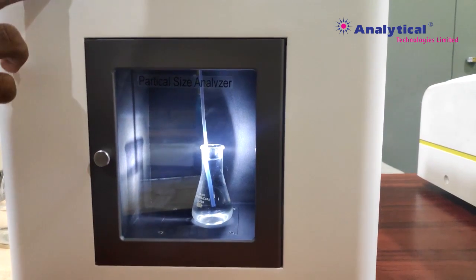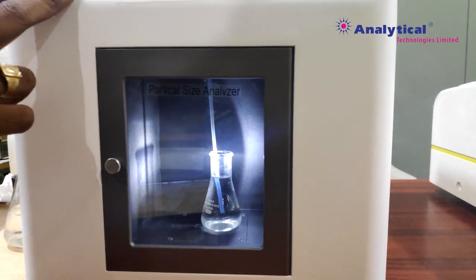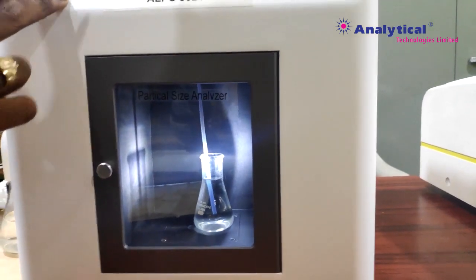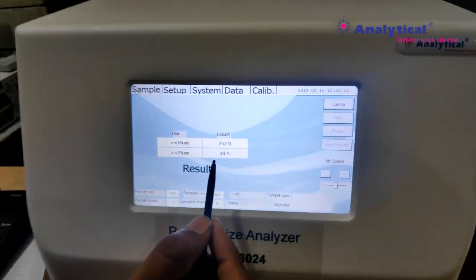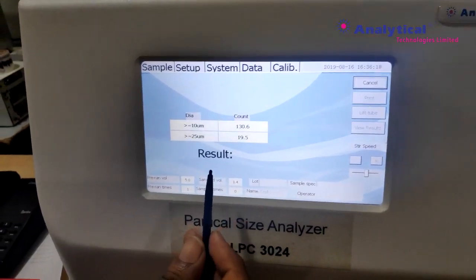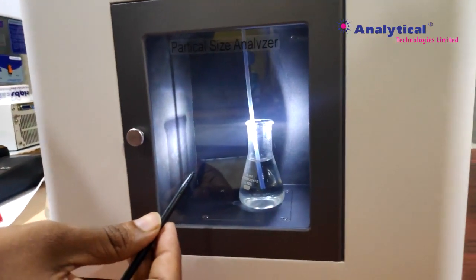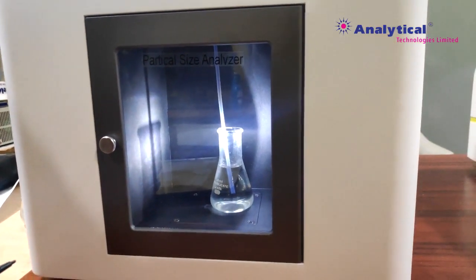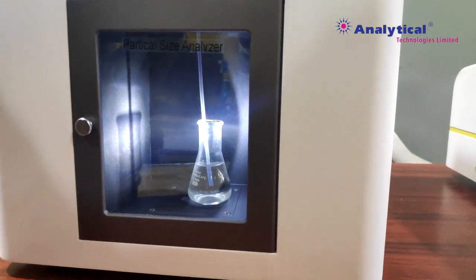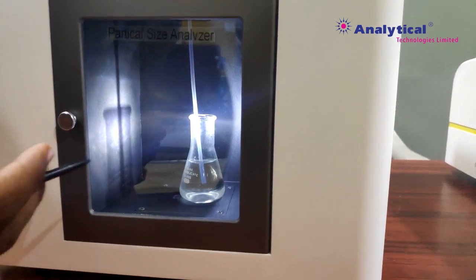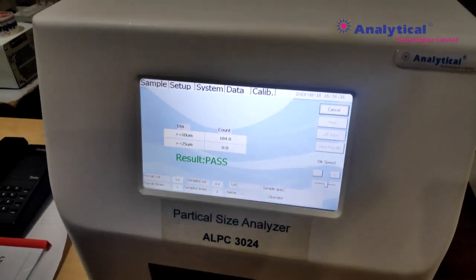First one. This is the data output for the sample. Second time. And third time. Then you can get the result with the average of three samples.